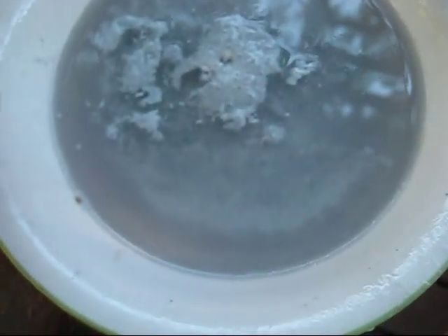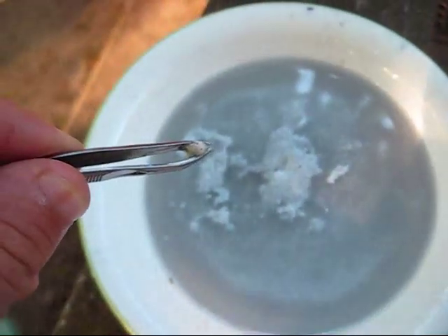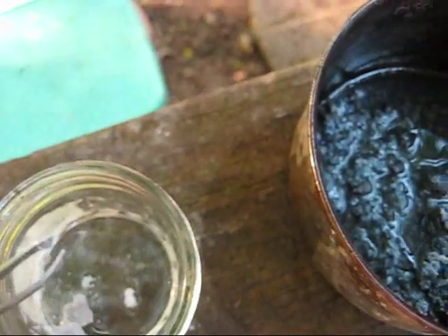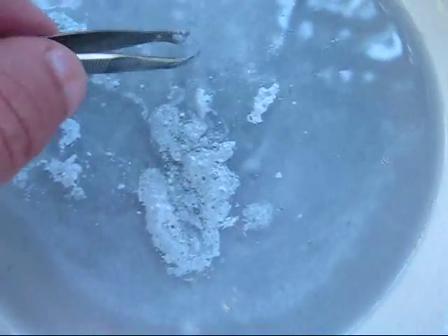But the ingots, as they heat up, will float on top of the oil and can be retrieved just like that. That is an ingot of sodium. It's a little bit wasteful since some of it has to react, but it's the only way I've found so far of separating raw sodium from the mixture.